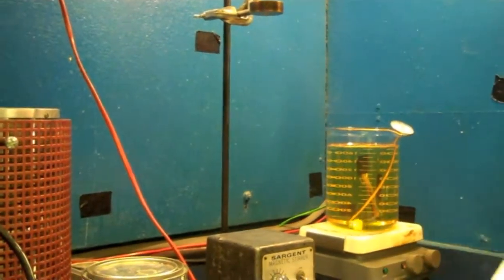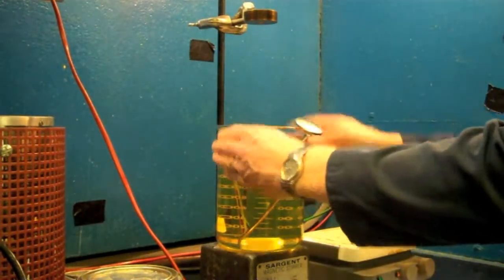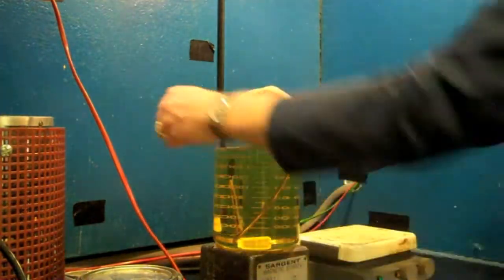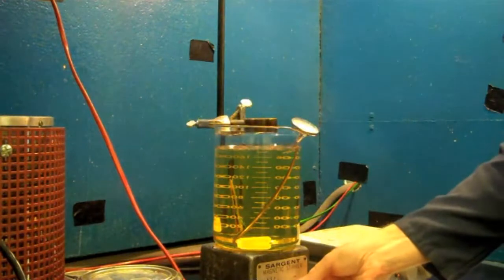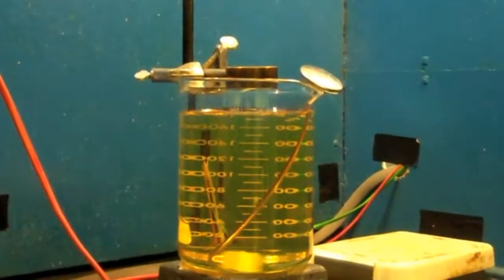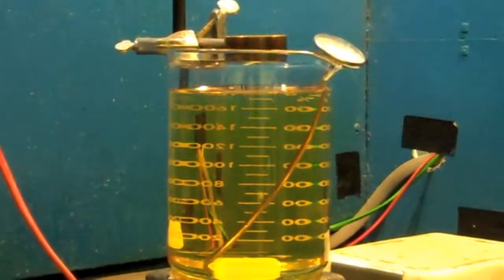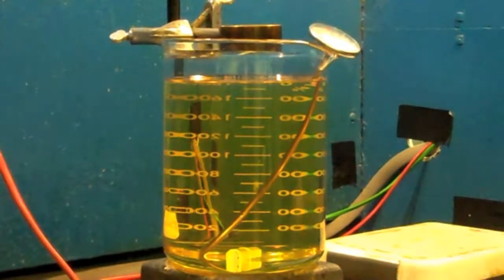we transfer the beaker of the oil to a ring stand that has a support for the test probe attached to the ring. You just initially make sure the temperature is at the required temperature of 140. Once we are there, we turn off the agitation. For quench oils, the test is run without any agitation.